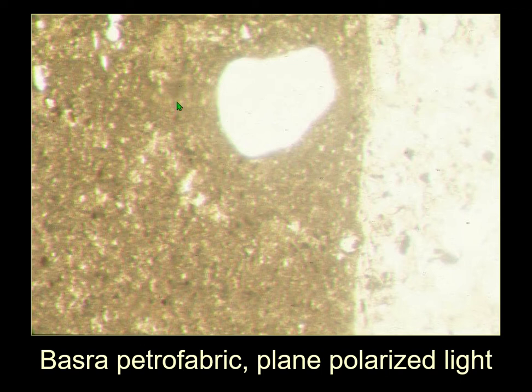And so this hasn't been levigated to look like this, because there wouldn't be anything in it other than very fine sand. This is a very fine deposit of clay. There is sufficient aplastics of a very fine size to make it a nice enough pottery fabric, and it has these on it as well. So they really lucked out with the clay here, and so they started making pottery, and it was all good.